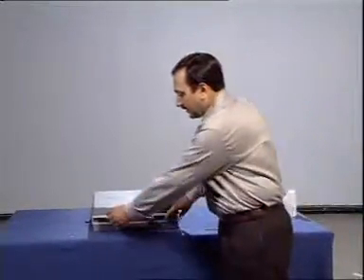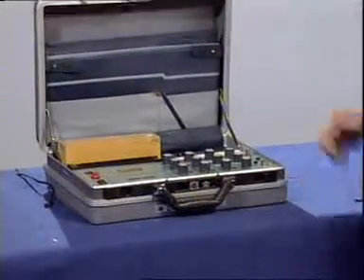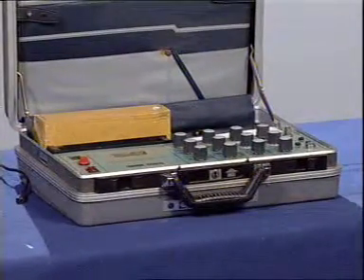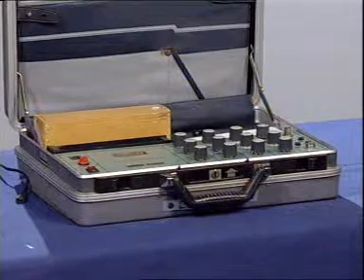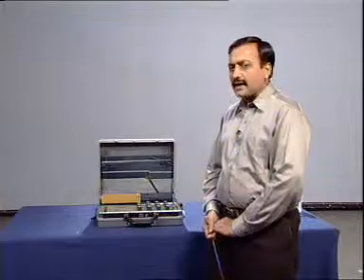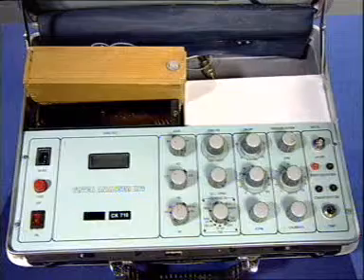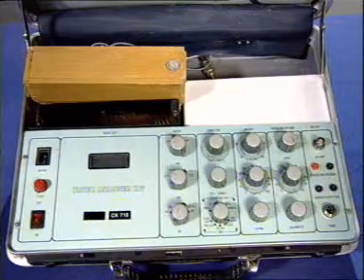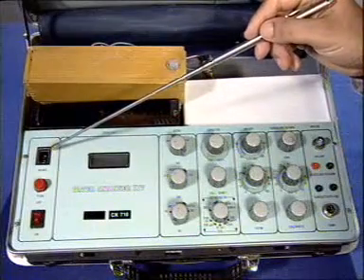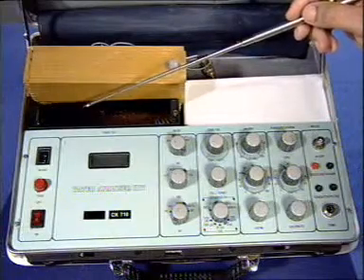A water analysis kit is a simple instrument which can be used to simultaneously measure various impurities like pH value, conductivity, total dissolved solids and temperature, etc. The instrument comprises various controls. The instrument can be operated using electric supply or a battery supply in case it is used in the field.